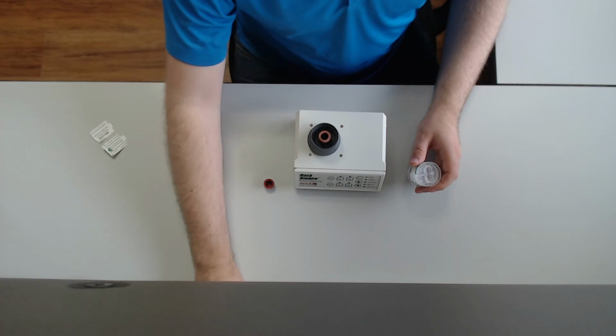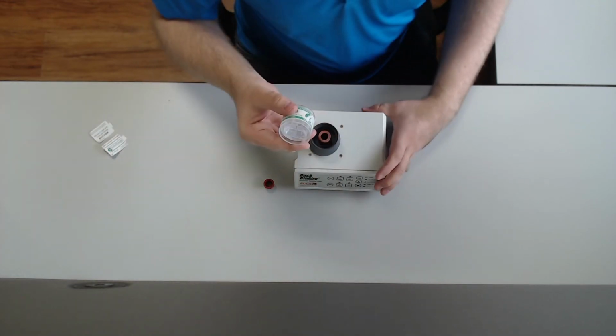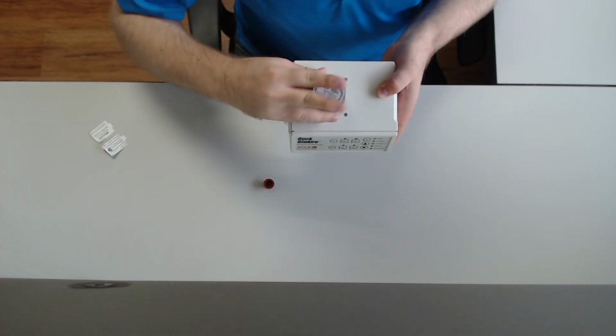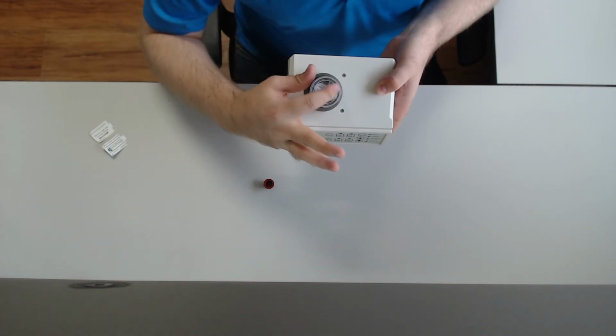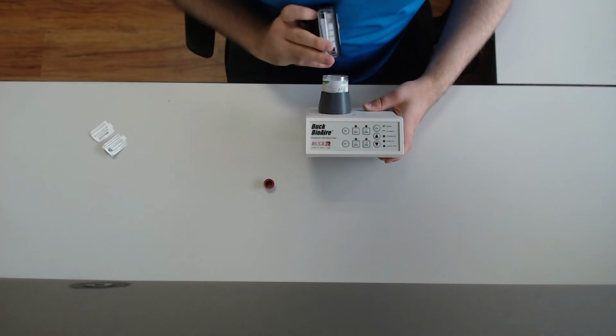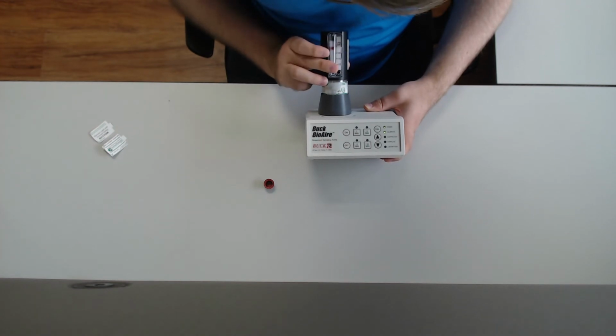Step 4. Push the cassette firmly down into the sample fitting until it fits snugly. The small circular side should be down, with the wide open face up. Start a timer immediately. Step 5. Place the rotometer on top of the cassette and push down firmly.